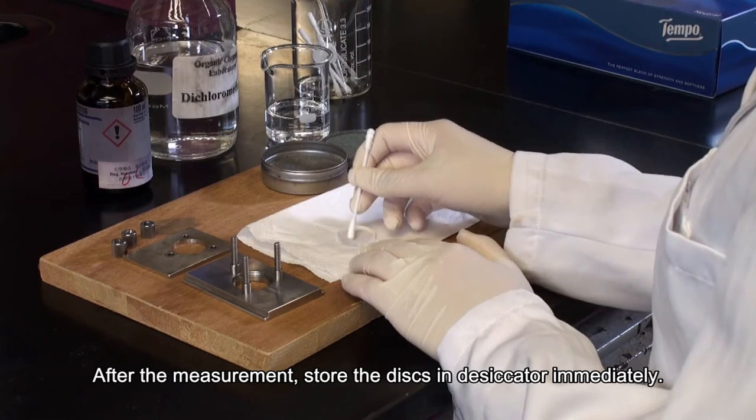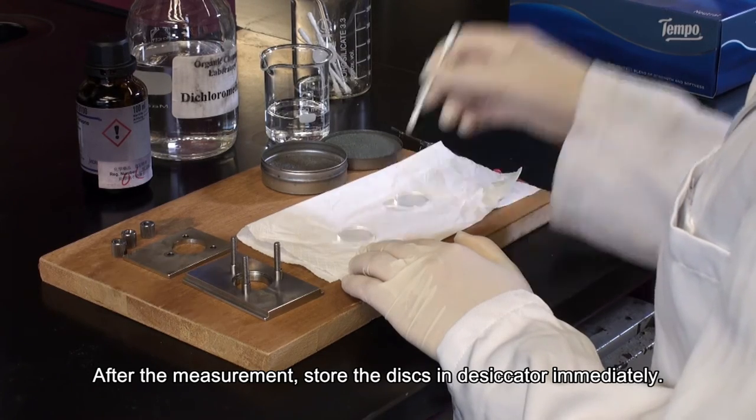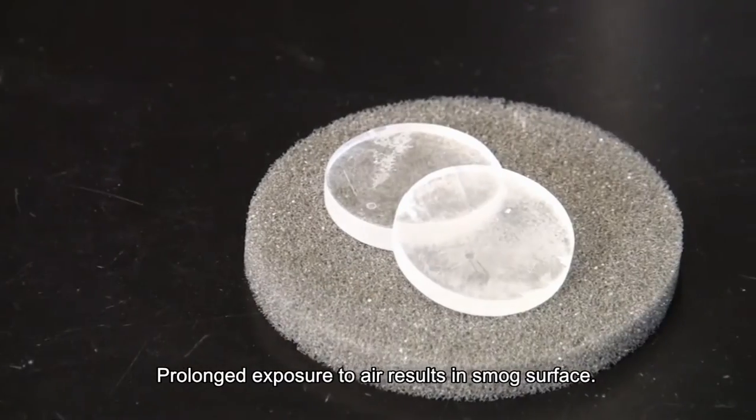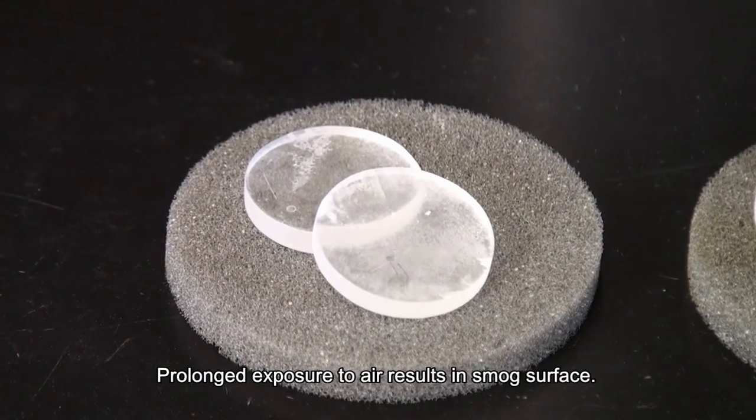After the measurement, store the disc in a desiccator immediately. Prolonged exposure to air results in a smog surface.